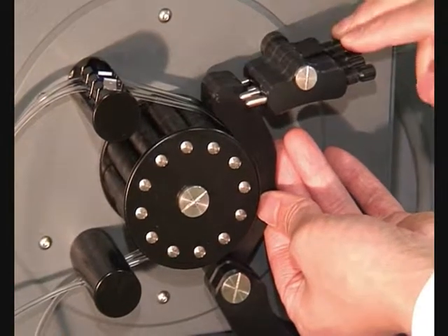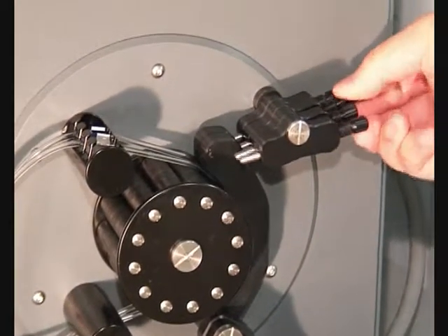Lock the pressure bars into place by raising the pressure bar clamps to their original position.